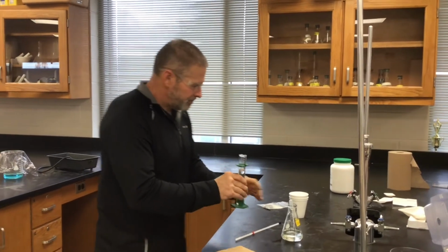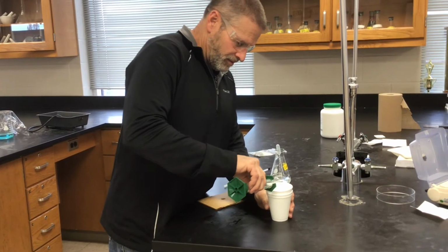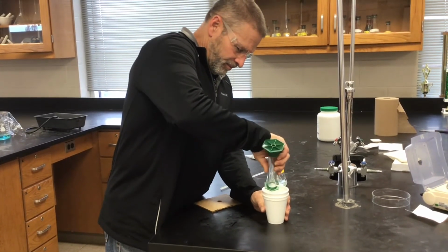Okay. And we trust you. We don't need to zoom in on that. We trust that you've measured out 50 milliliters of the HCl.